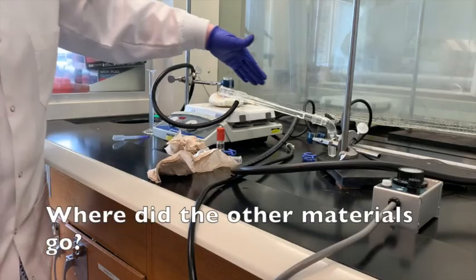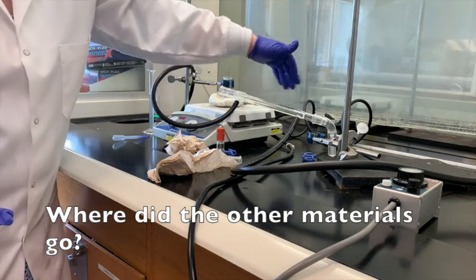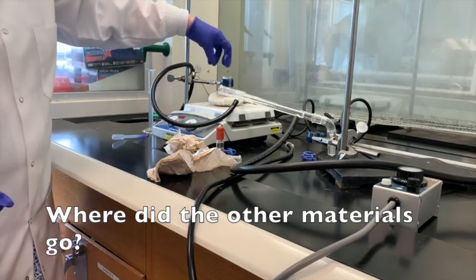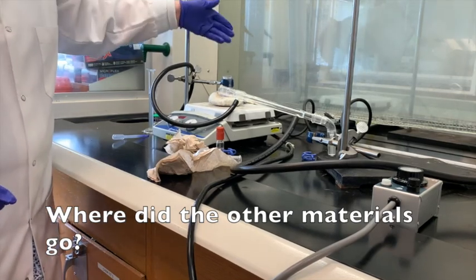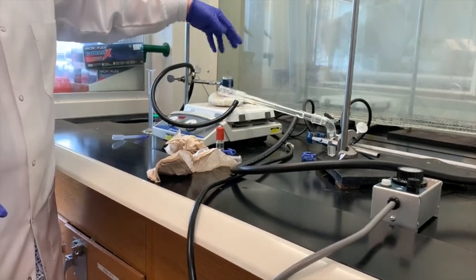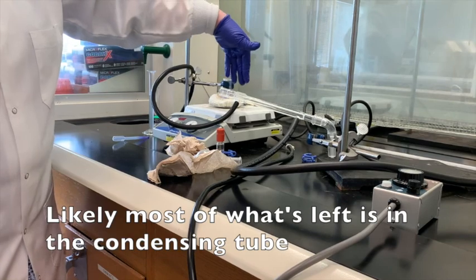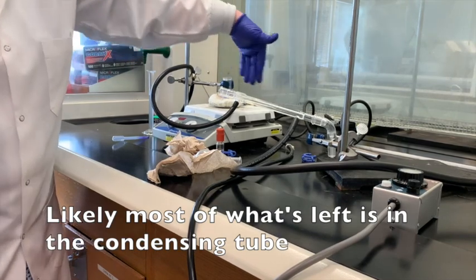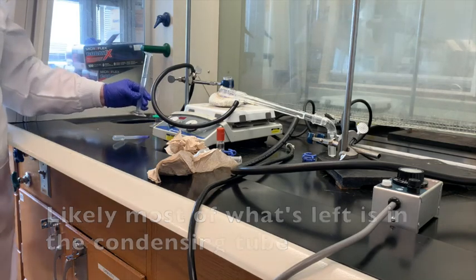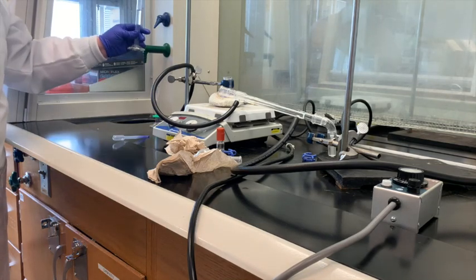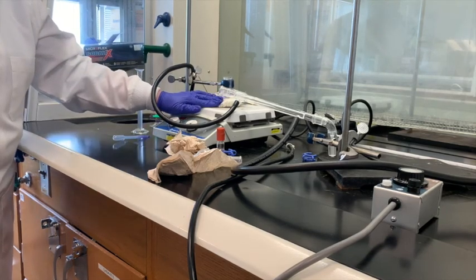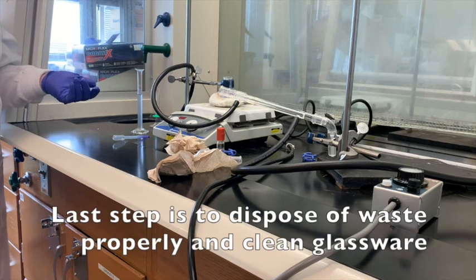The question is, where did the other material go? There's always going to be some material that's still left in the condenser that never moved over to the receiving flask. Even though we had grease, there's always a possibility that you could lose some vapors through wherever these joints are. Less likely so much of that. I think probably more could be still left in this condensing column here. 8.7 mils, that's a pretty good return in terms of the separation of the methylene chloride from the crystal violet that had that purple color.